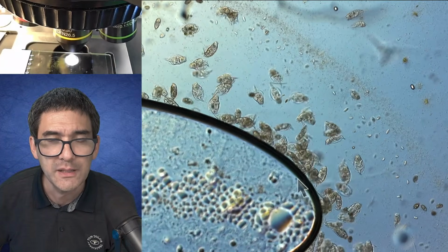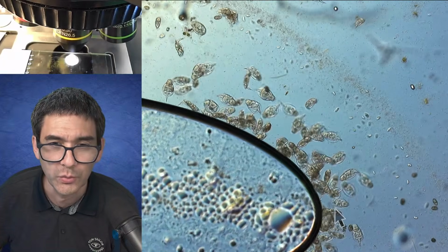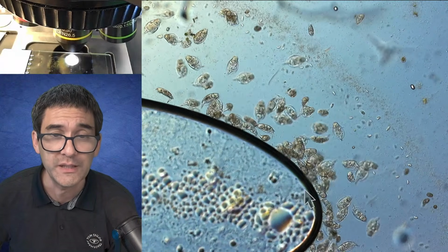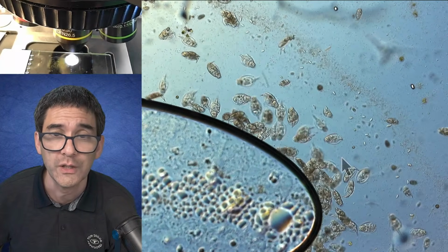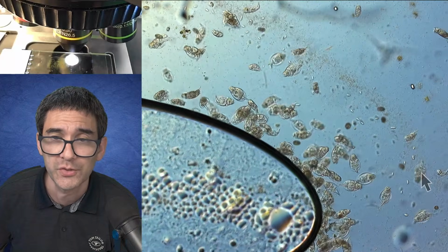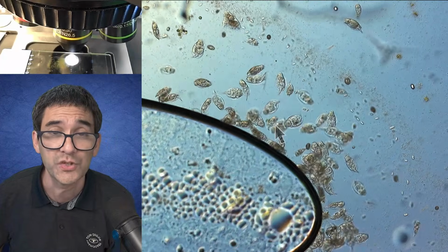This means that those rotifers, which are actively moving and need a lot of oxygen, will of course like to be next to the air, right? Because the oxygen diffuses into the water, and then they have oxygen here. Over here you see those bacteria, the bacterial front, as we call it, and it also moves towards the oxygen.